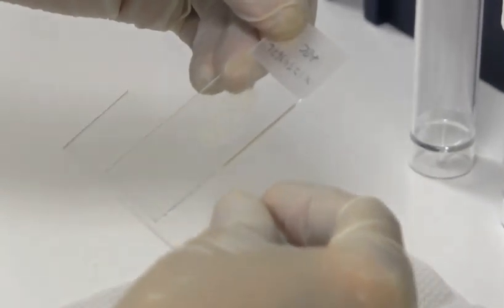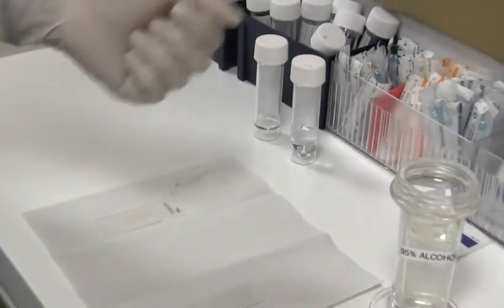After which you very gently just slide it down, and immediately fix in 95% alcohol.